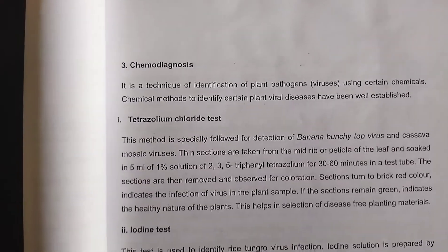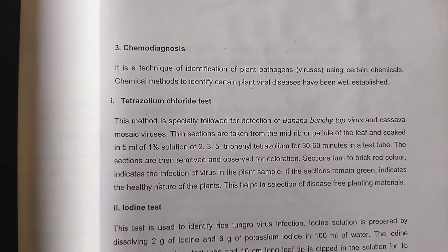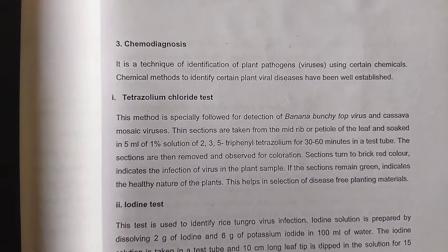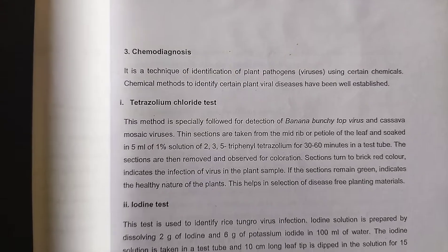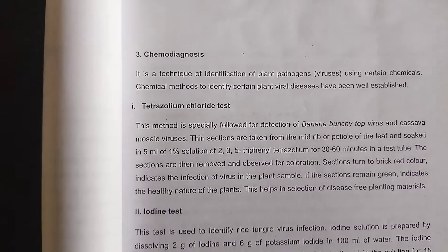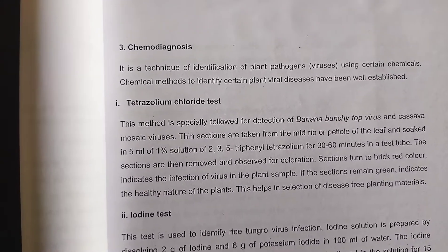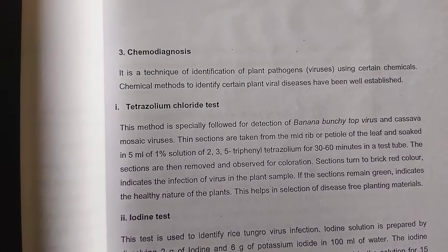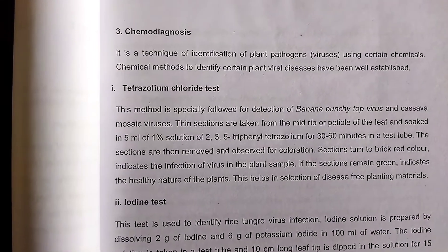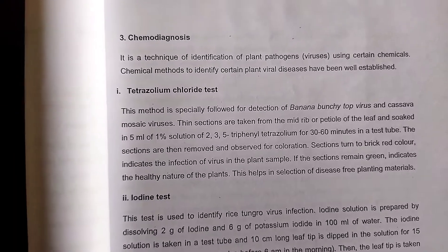Chemo diagnosis is very useful to diagnose viral diseases prior to symptom production. The first important test is the tetrazolium chloride test, which is mainly used to diagnose banana bunchy top virus and cassava mosaic virus prior to symptom production.